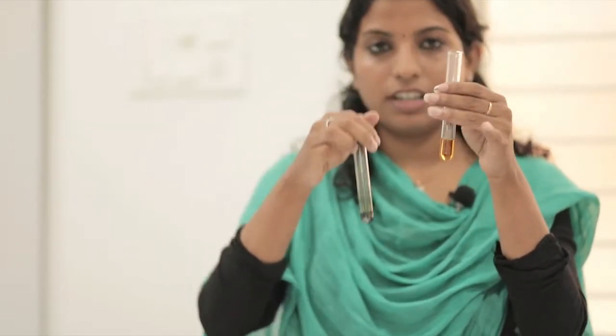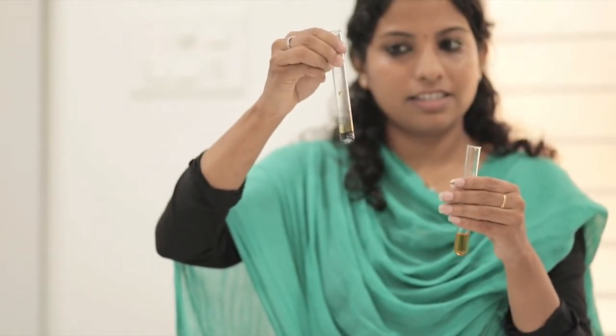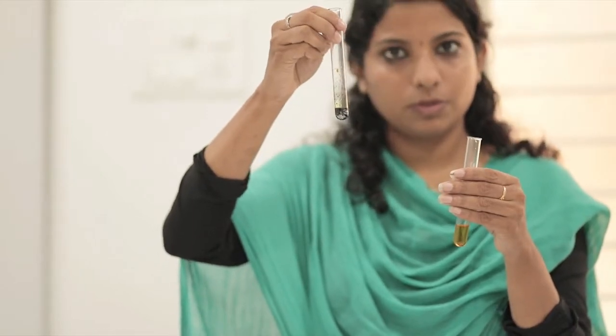So, I have two test tubes. In one test tube I had rice solution and in the other, water solution. Now we can see the color has changed. Rice solution color has changed from yellow to blue color. This water solution is yellowish-brown color. We can conclude that rice solution contains starch. Food components with starch will turn blue-black color. So this is the conclusion — rice solution contains starch. In continuation, we will do the test for protein and test for fat, and that is how we will finish the video.